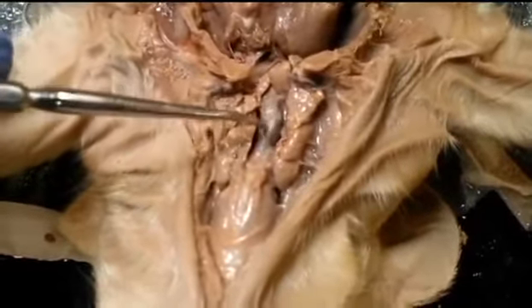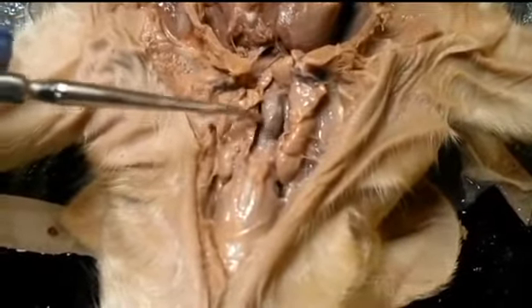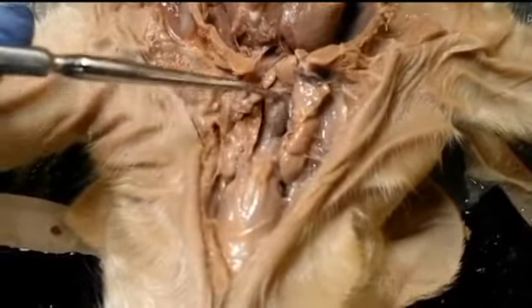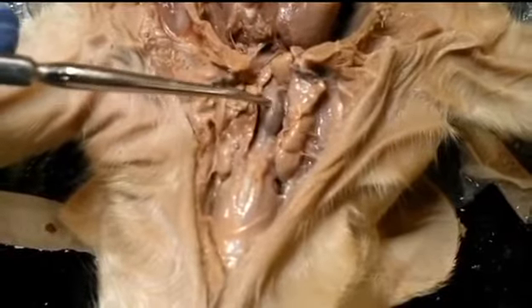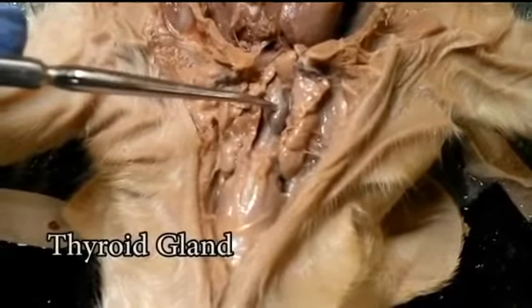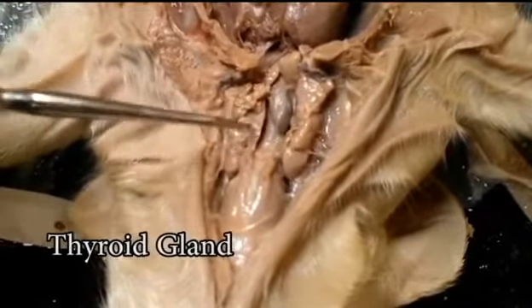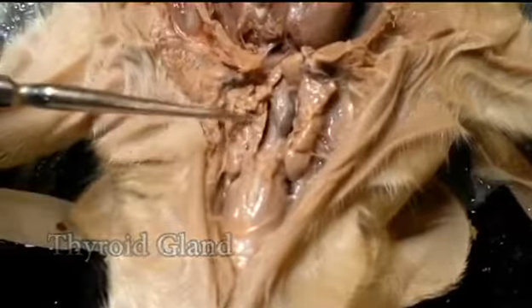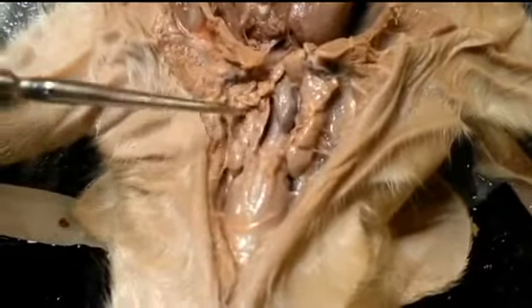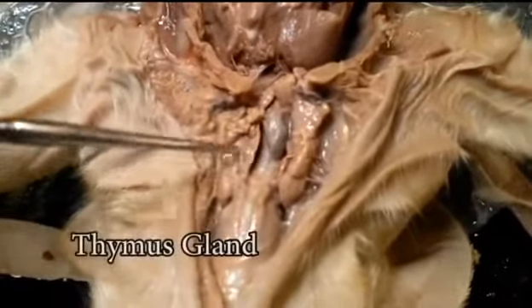Starting down here, this football-shaped, almost brown-like structure is the thyroid. On either side of the thyroid we'll see the thymus glands.